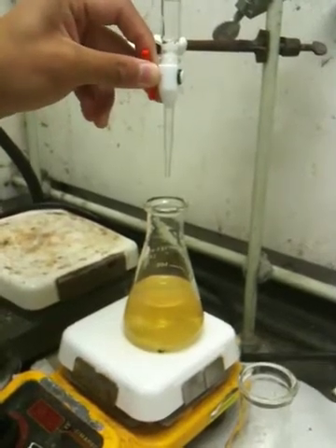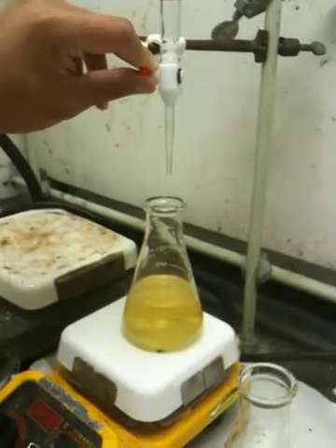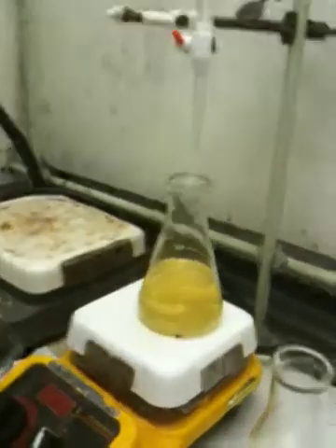Trust, you're good. You're good. Alright, one more — you're good? I'm good. He's soft, as you can tell. It is definitely a nice yellow looking color. His volume measurement is at 16.8. Yep, 16.8.